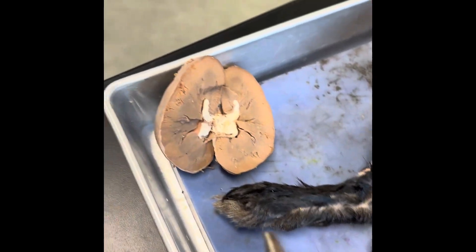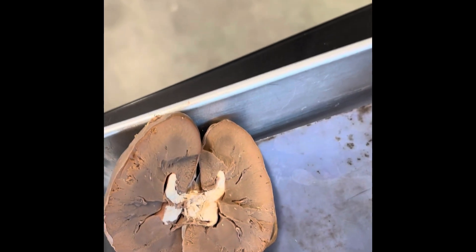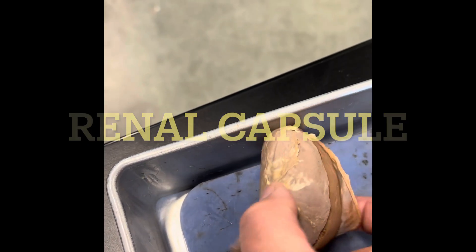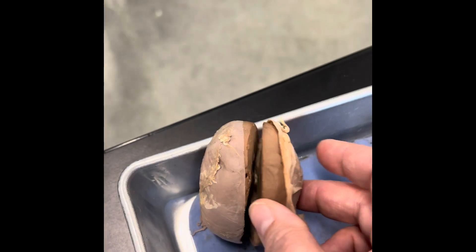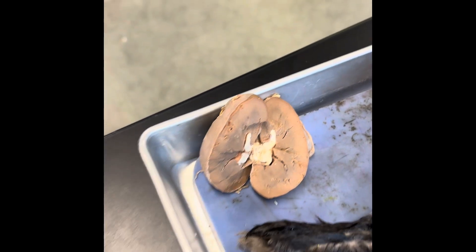Here is another kidney we have set up here. Here's the lighter cortex, the medulla, and the renal pelvis. On this kidney you can see the renal capsule — it's the covering that goes around the kidney. The renal capsule here and then here's the ureter coming out. If you open that up you can see the renal capsule, the kidney, the inside of the kidney, and then the ureter.